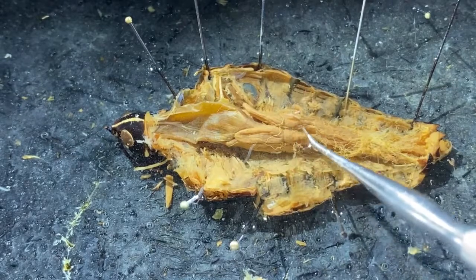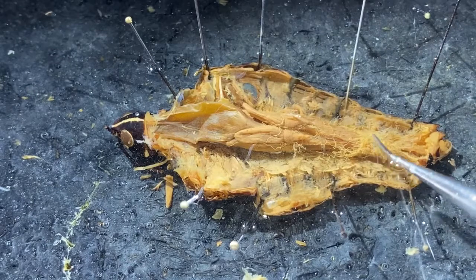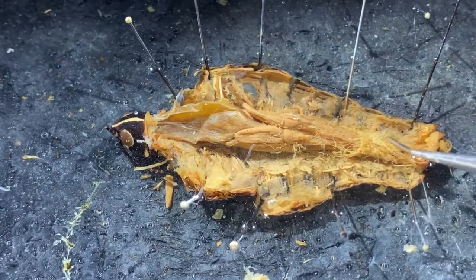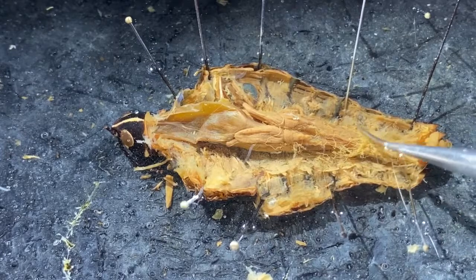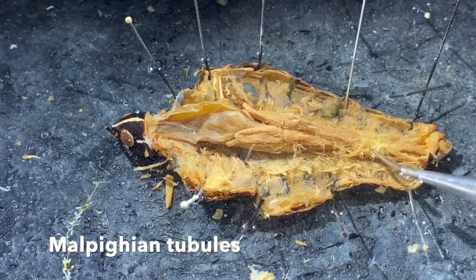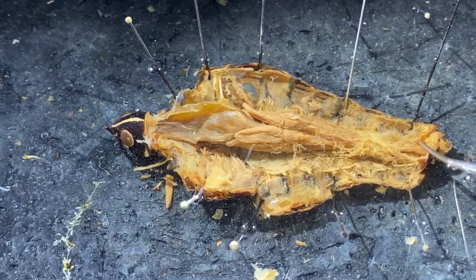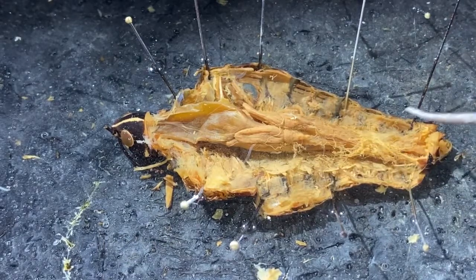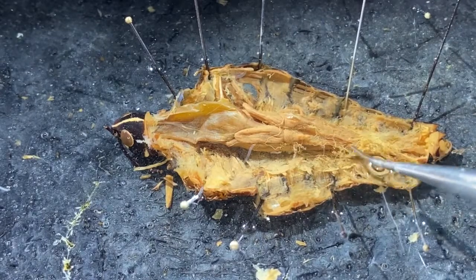Then we have the stomach, which makes up the midgut in this animal, coming back to this point right here. And you can see all these little thread-like structures. These are Malpighian tubules. This is the connection point between the midgut and the hindgut. So with the gonads removed, you can see that connection and this mass of Malpighian tubules.